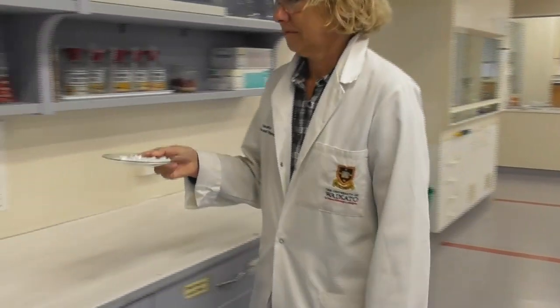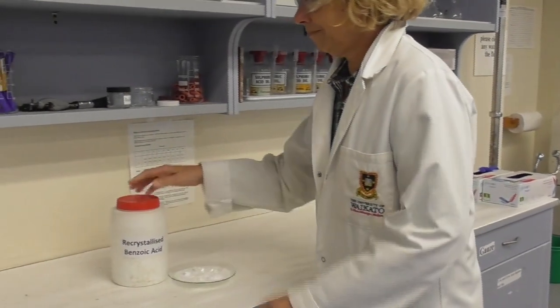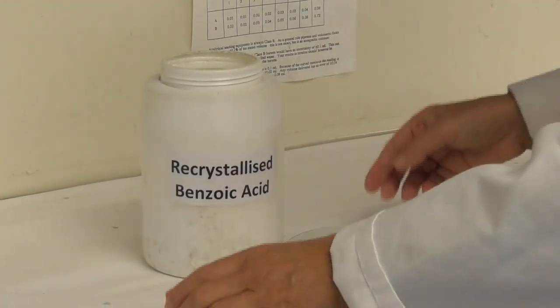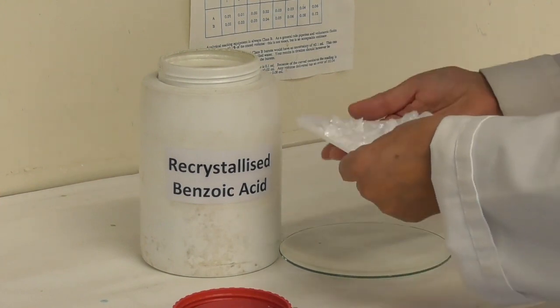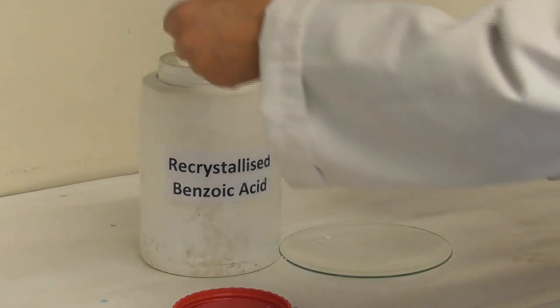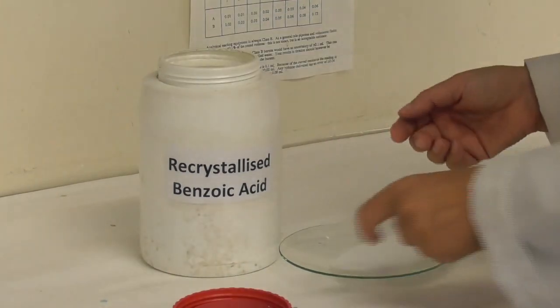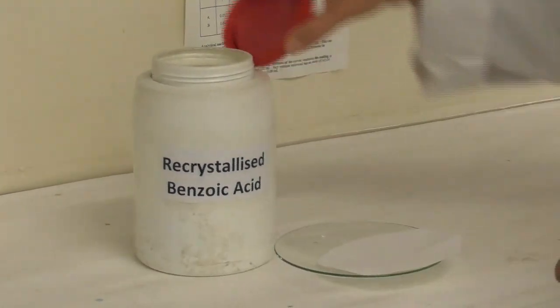At the end of the experiment when we are done with all the testing, the recrystallized benzoic acid gets collected in special containers.